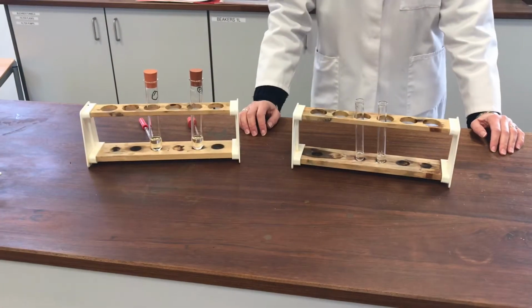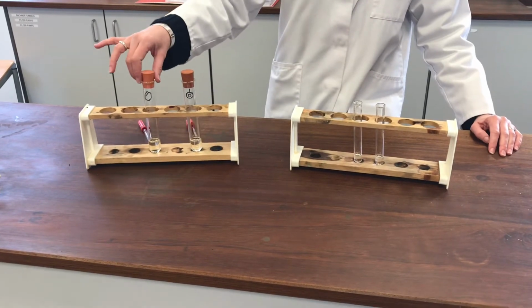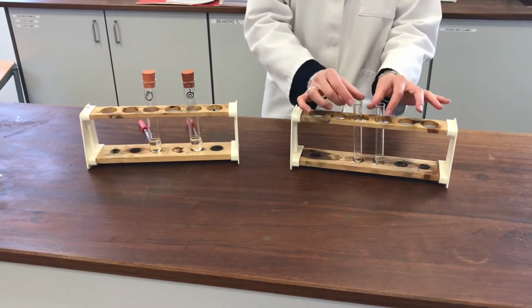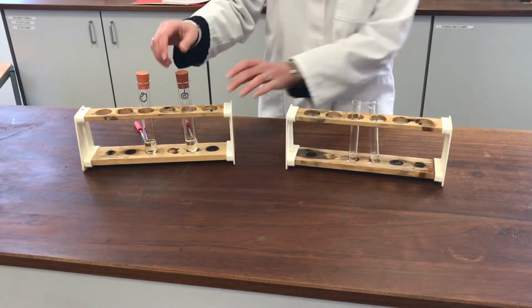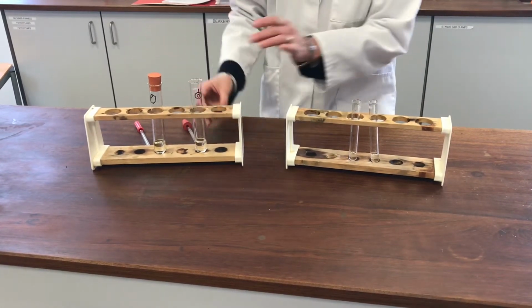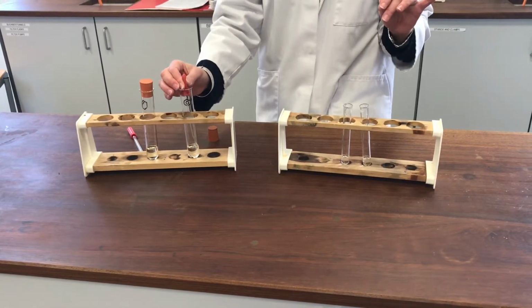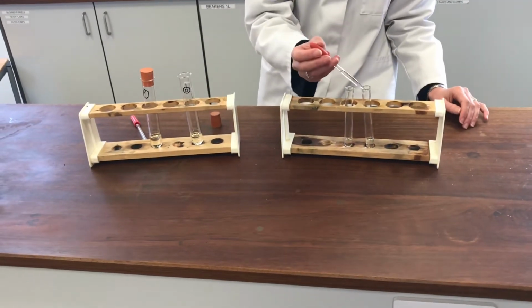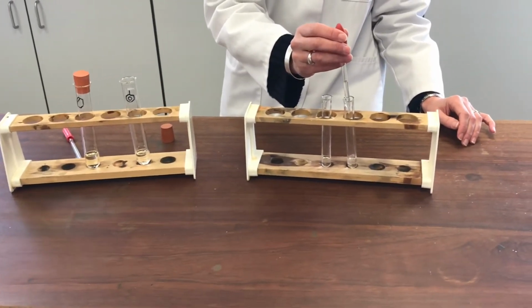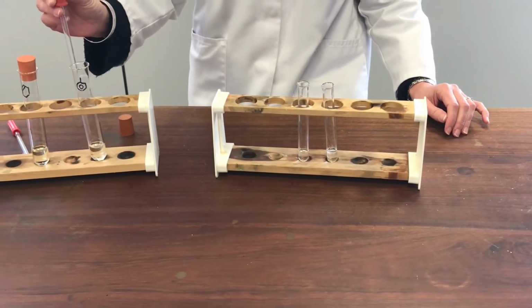Okay, so this is the final stage of the experiment. Again, same two molecules, benzene-based molecule, cycloalkene, and this time I have portions of concentrated sulfuric acid. I'm going to try adding my organic molecule to them. So we'll use the benzene-based molecule first. Small portion added to the conc sulfuric.